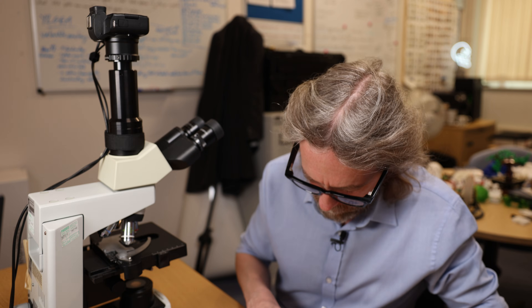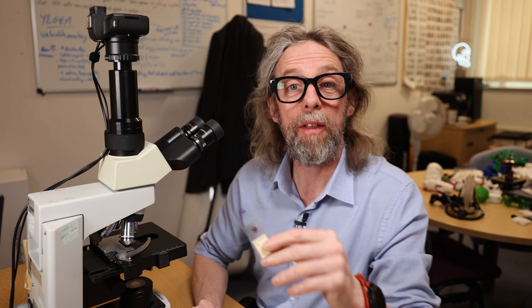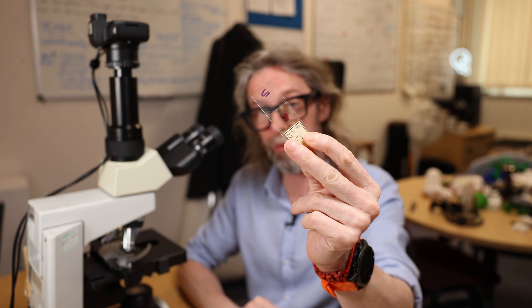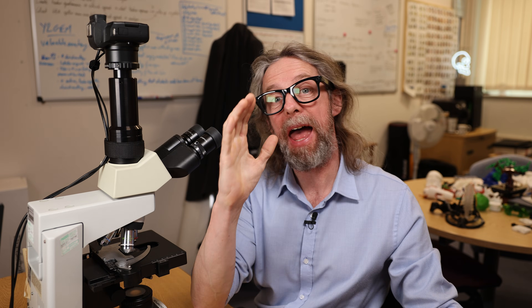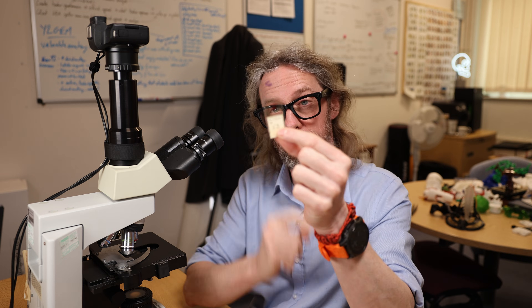The tonsils are organs of the immune system. We were looking at lymph nodes last week, which are also organs of the immune system, so if you look at the tonsils under the microscope we should see some very similar structures. But tonsils are interesting because they're in the throat, in the pharynx, so they are defending this entrance way to the body. People commonly get tonsillitis and tonsillar stones.